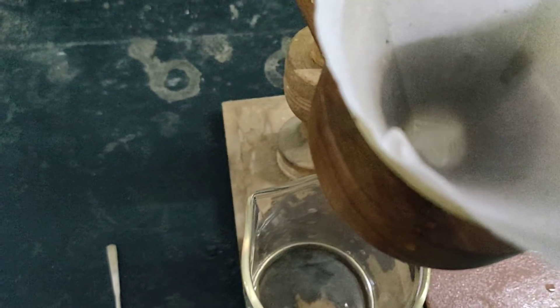Now we are supposed to wash it with acetone. So acetone removes adhering water, and drying will become very easy for us.